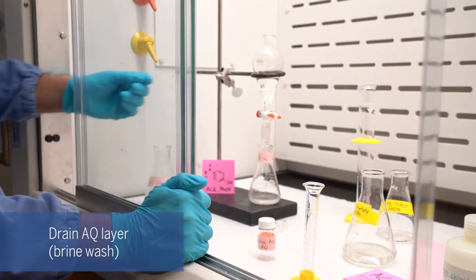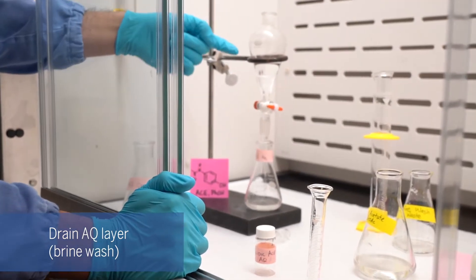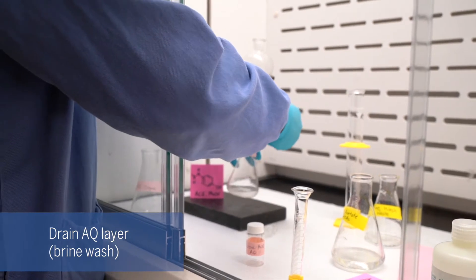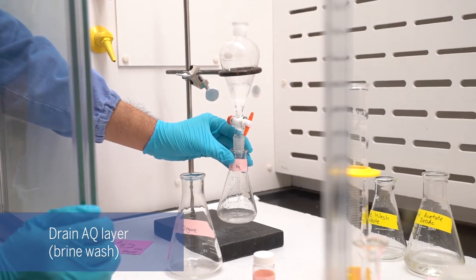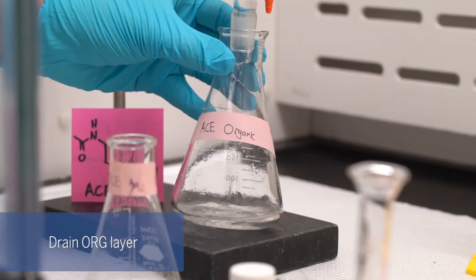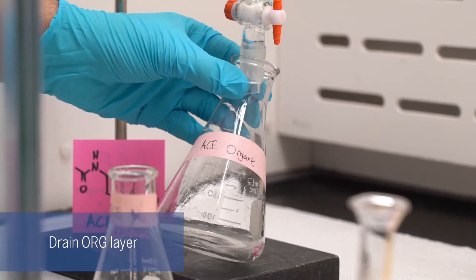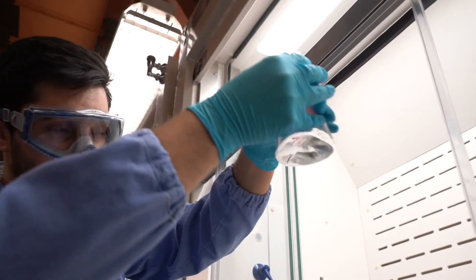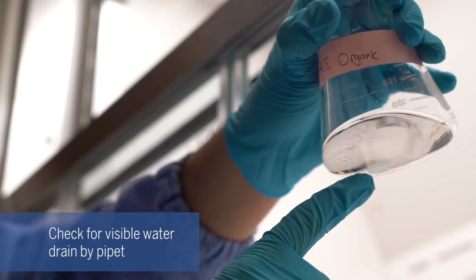Once the two layers have separated — with the aqueous layer on the bottom and the organic layer on top — we're going to flush out the aqueous into our acetaminophen aqueous flask. There seems to be a little blob in there, so we're going to go ahead and try to remove that with a pipette.